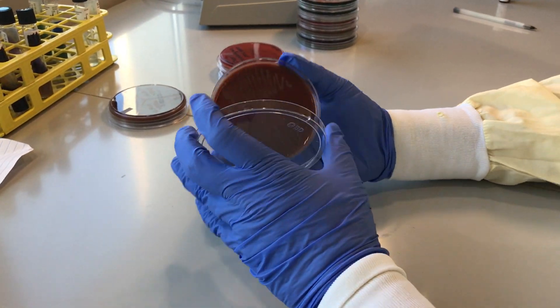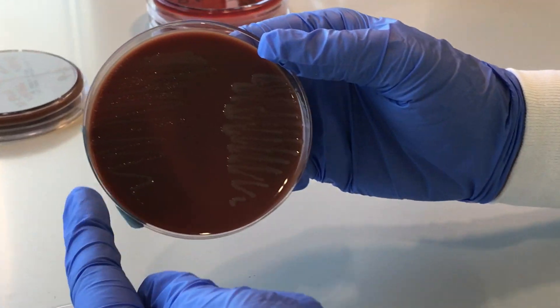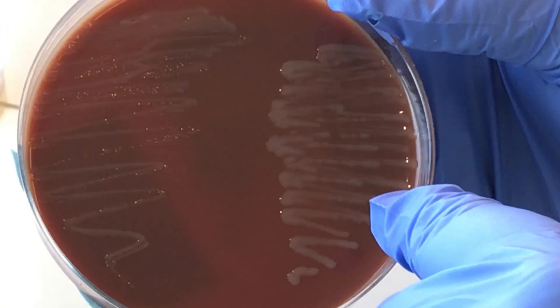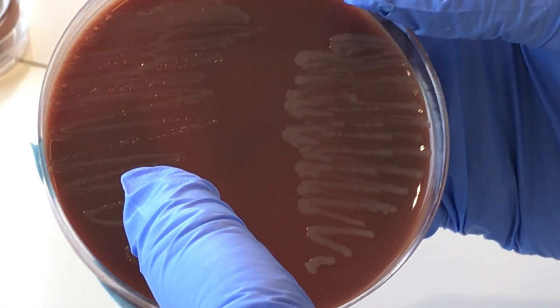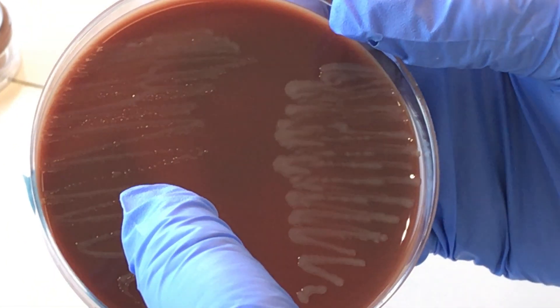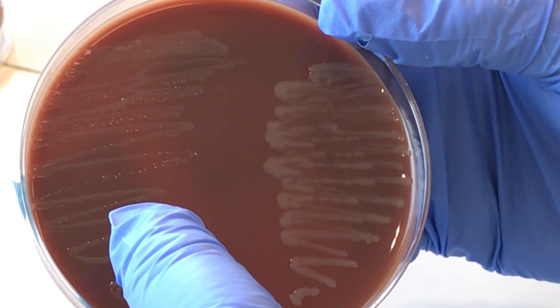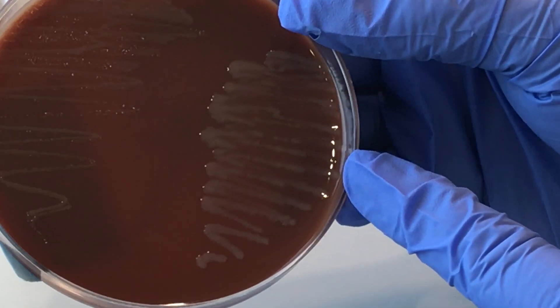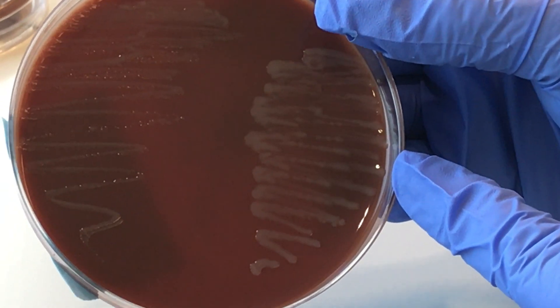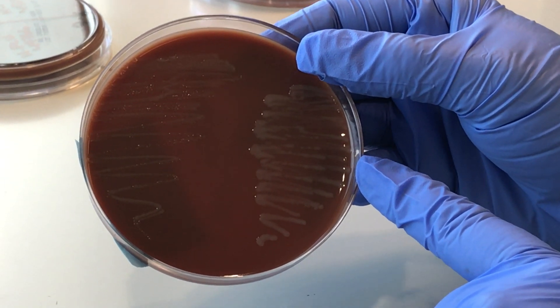This is Neisseria gonorrhoeae, and this is Haemophilus influenzae. Neisseria gonorrhoeae, as you can see, it doesn't grow very well. It's kind of wimpy and it only grows on chocolate and media specific for gonorrhea, like New York City or Modified Thayer-Martin. Haemophilus influenzae will only grow on chocolate. Other types of Haemophilus may grow on blood as well.